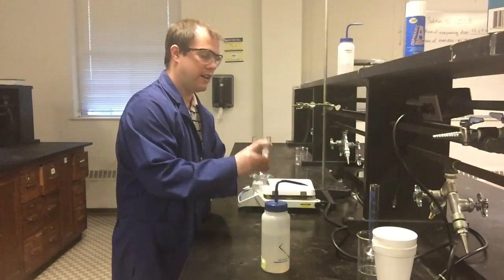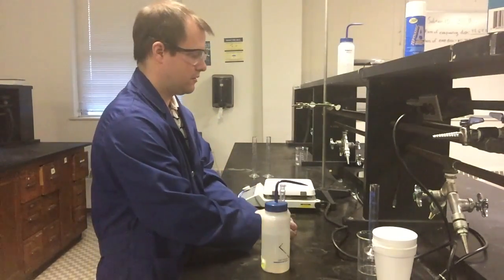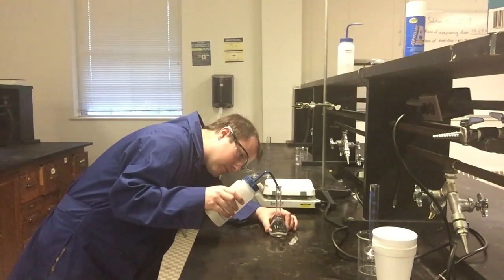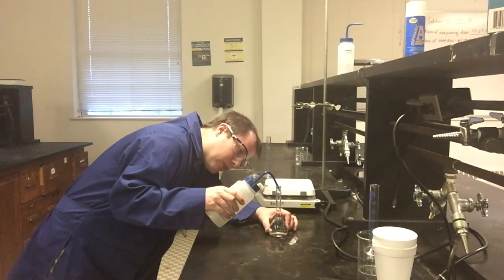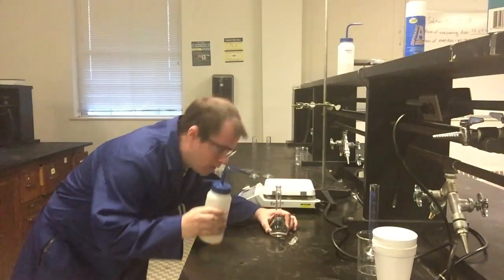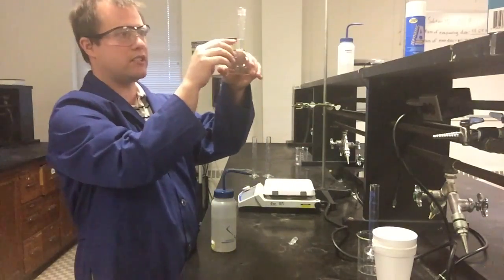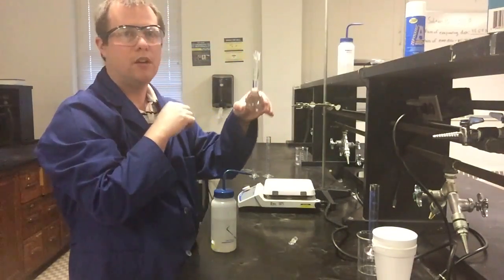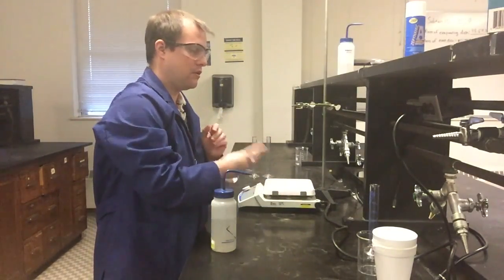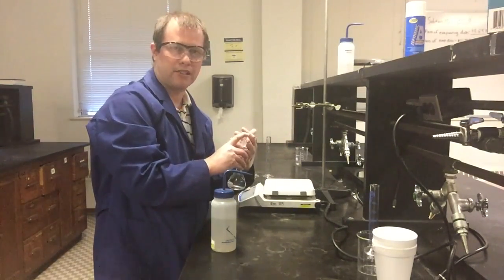And then what I'm going to do is add this last little bit of water to hopefully get our volume spot on. And again, remember what I'm doing at this point is looking to get that water exactly on that line for my volume. And it looks like I'm pretty much dead on, with the meniscus right on the line for my volumetric. So now at this point, I'll mix this one last time here, but I should be good to go ahead and divvy this out and get ready to do my acid-base reaction.